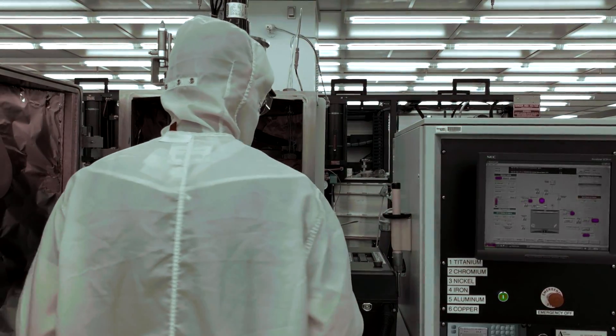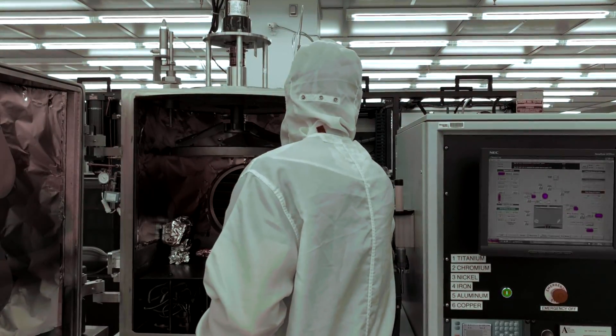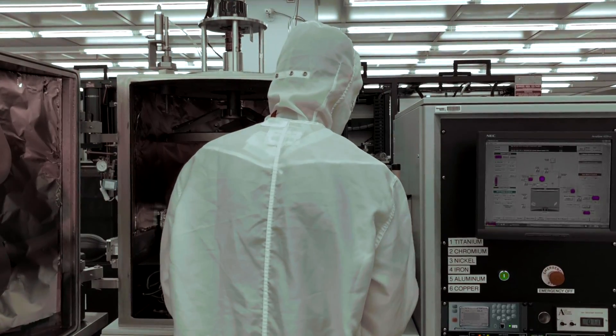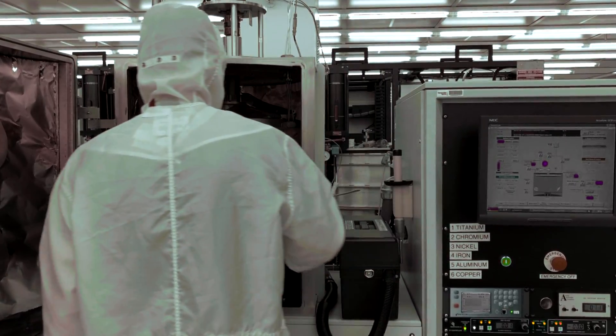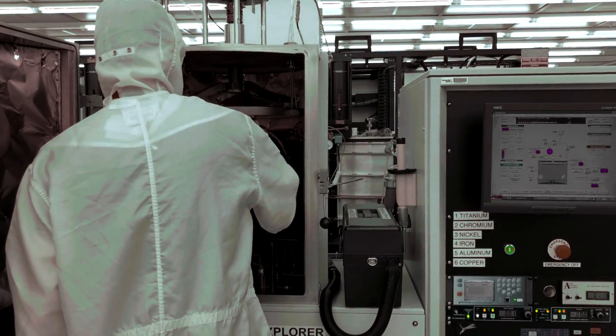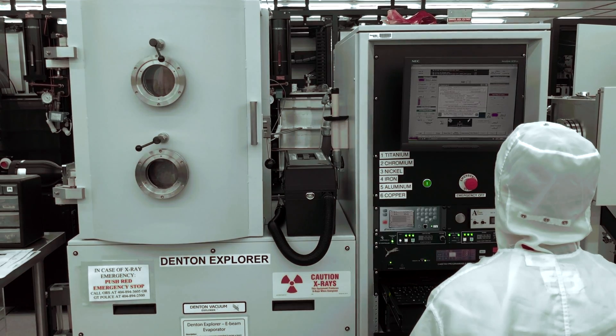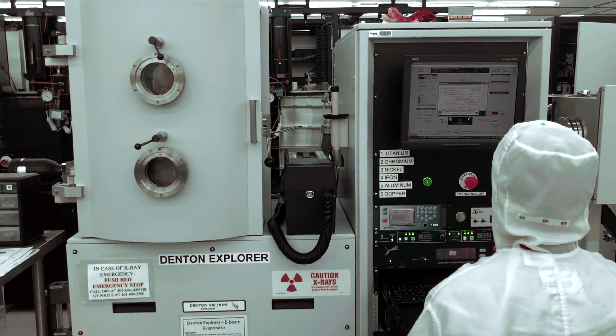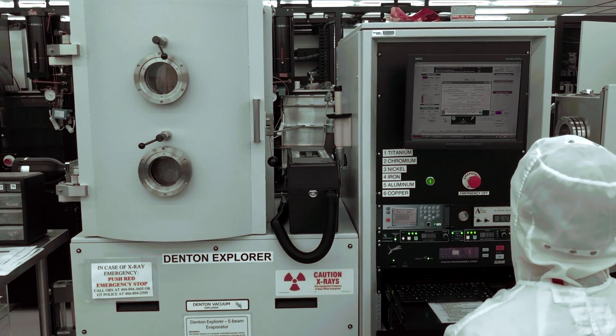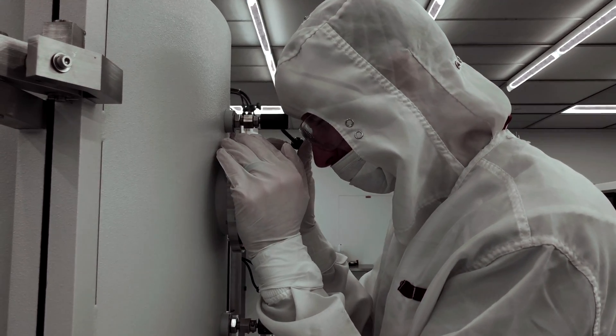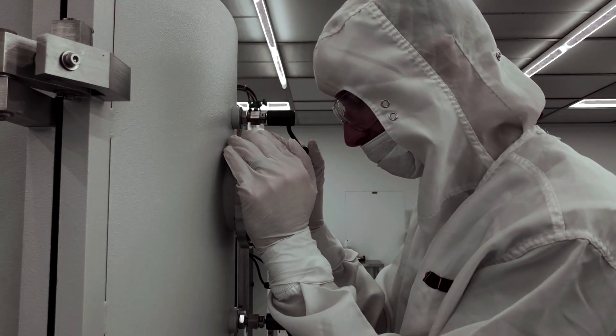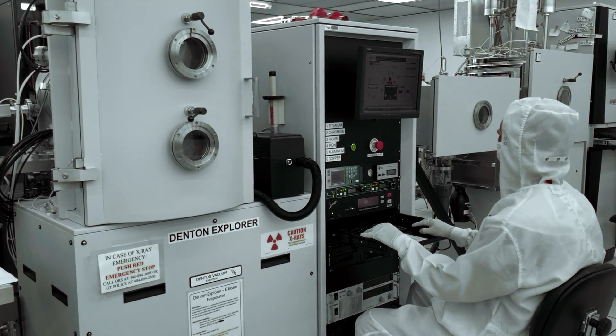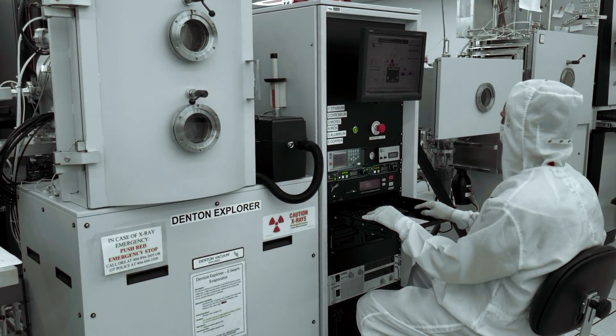To prevent risk of personal injury, it is important to note the various sources of personal injury associated with this equipment. These include coming into contact with a hot sample or plate or improper operation of the machine. Thus, one should take care to let samples cool for at least 10 minutes before venting the chamber and also to not stare at the beam for any extended amount of time. You should also note that users are not allowed to change system settings unless approved by staff.